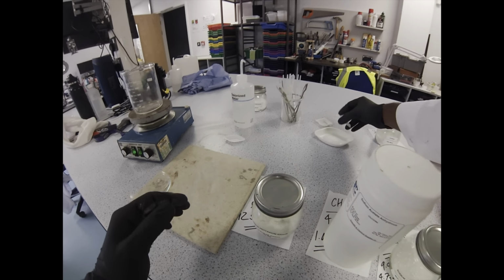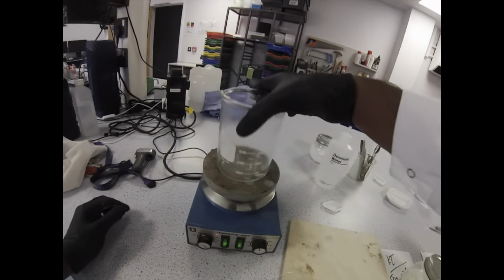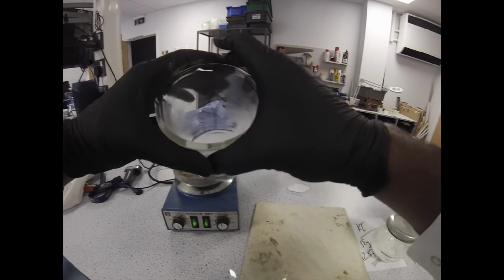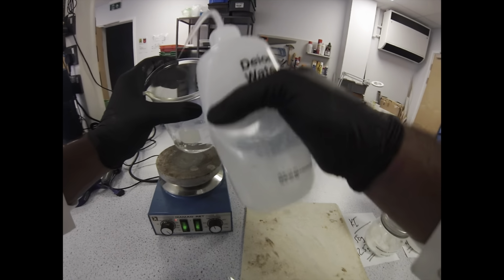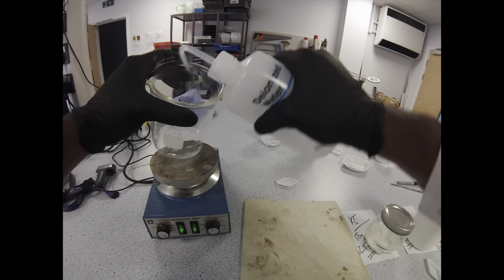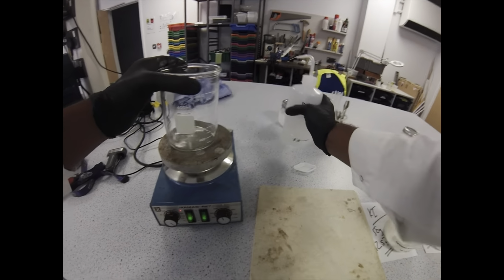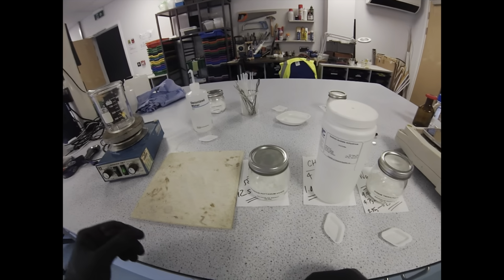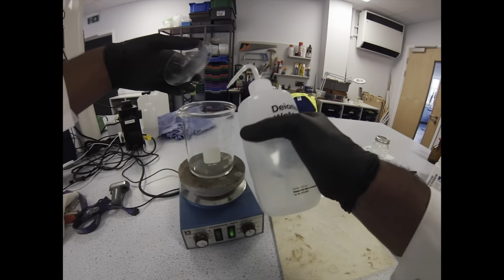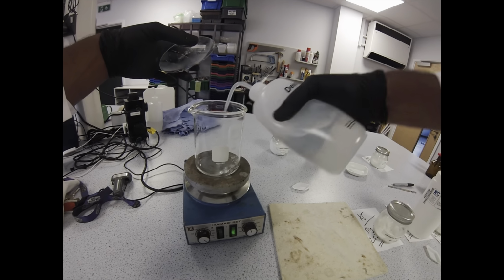Okay, so now that the initial part of the solution has gone clear, I can just start adding a bit of water just to bring up the volume. That way I can definitely leave it on the stirrer and be safe. Rinsing down the sides of the beaker just to make sure every little bit of starch is in there. Watch glass goes on the top, and then we're just going to bring that up to temperature now. We're looking for about 70 to 90 degrees. Make sure all the granules are hydrated and that everything is definitely soluble.